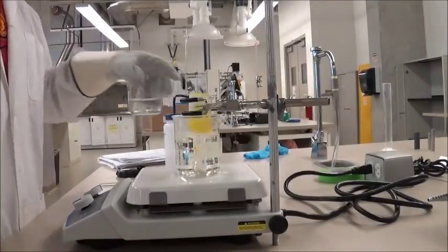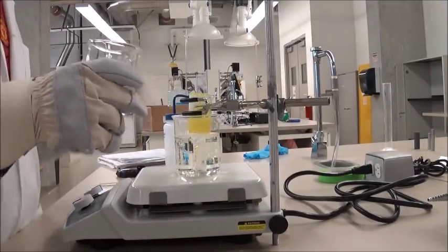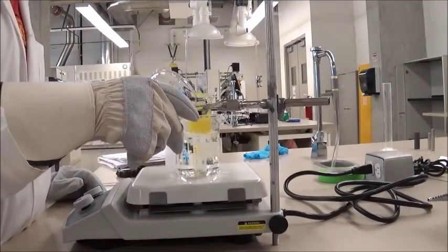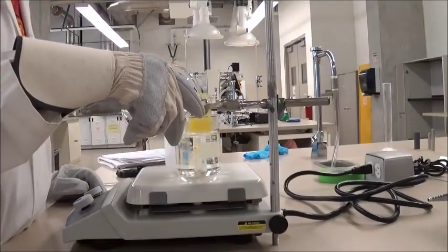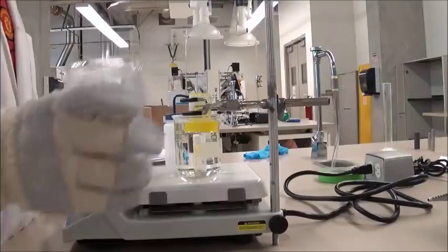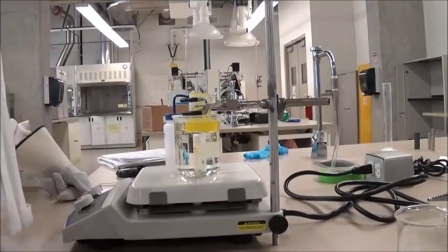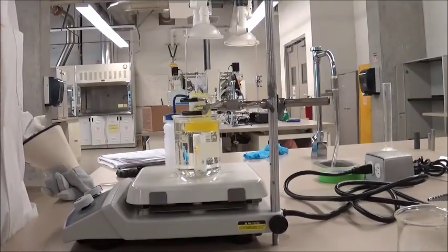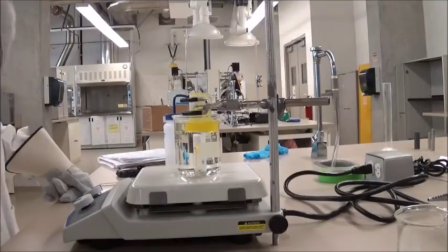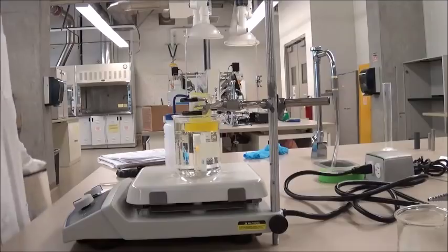And if you notice that once again your water level in the hot water bath has decreased, you can carefully top it up on the side from the 250 milliliter beaker, making sure none of the water goes into the 25 milliliter beaker, to ensure that the hot water bath is full. And once again, you must heat the 9-fluorenone and unknown solid such that it melts again, and then you will repeat the process of measuring the temperature every 15 seconds to get a second set of data.